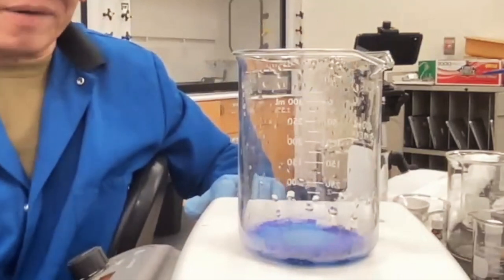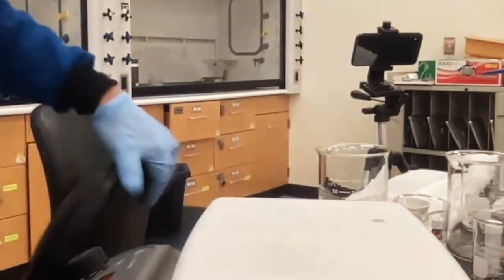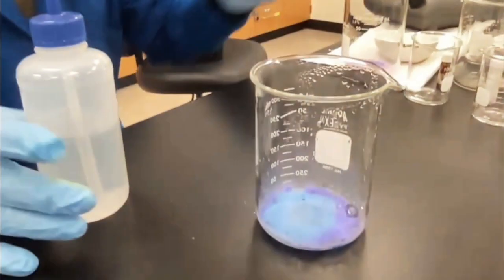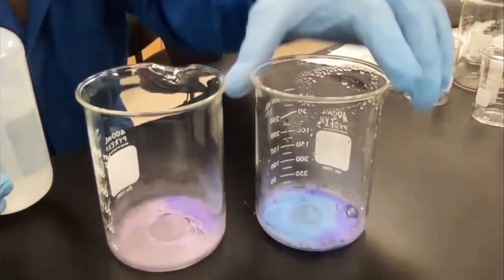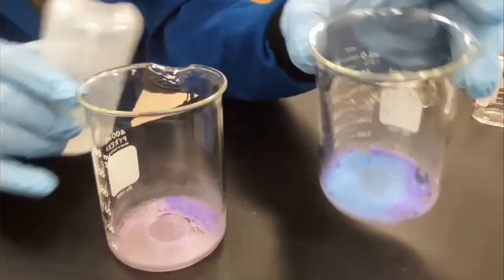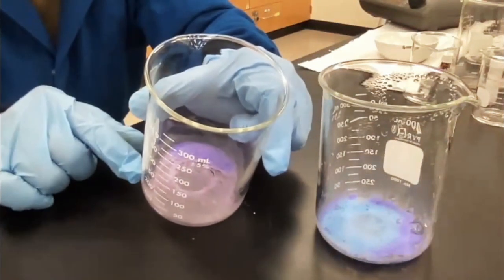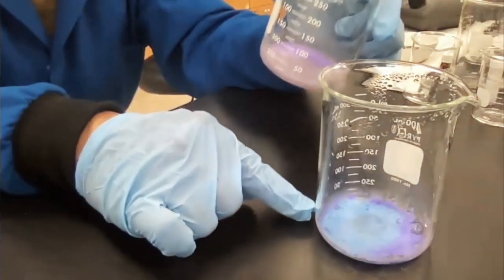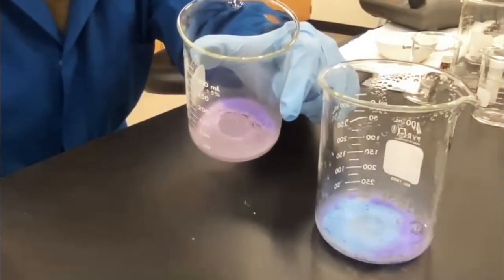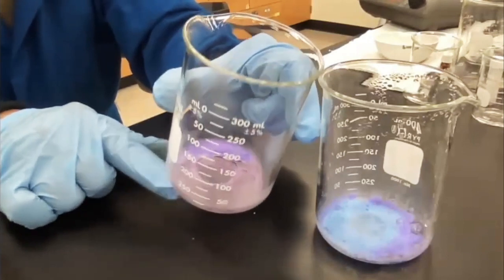So we're pretty much done here. The water has completely evaporated. I'm going to take out the hot plate so I don't get burned. Let's take a look at this right here. First, I'm going to take the dry one. So see, it's hot. It's heated. It's got no water. This one has been sitting around for about an hour. And what has happened is that the chemical that was this is now picking up the water in the air, because we've got water in the air because of the humidity. And when it picks up the water in the air, look what happens to the color.